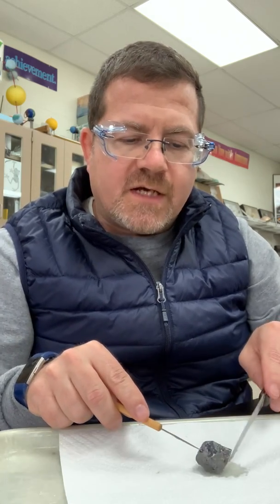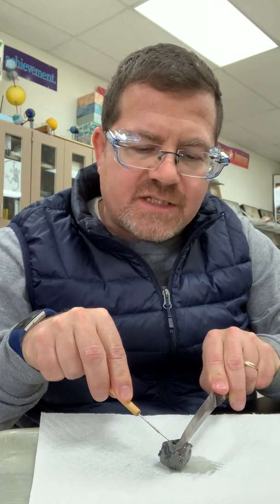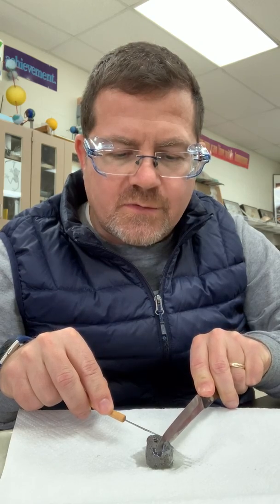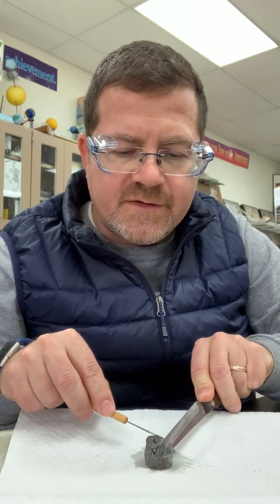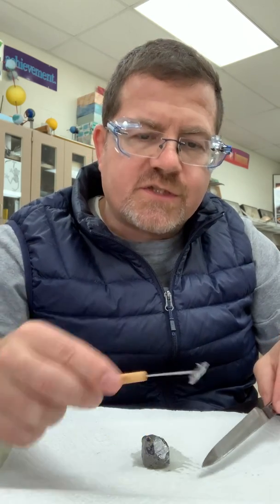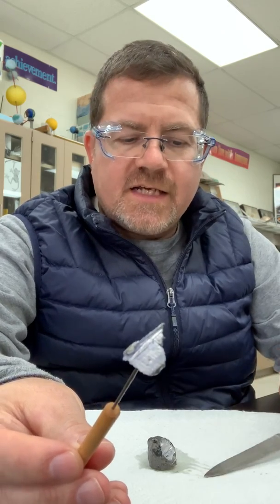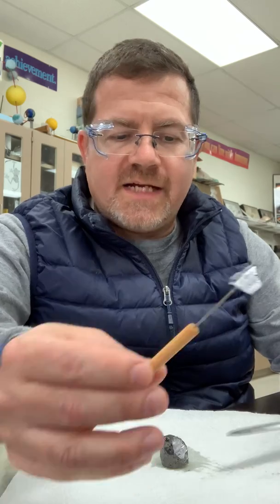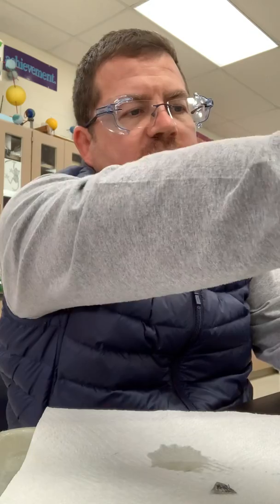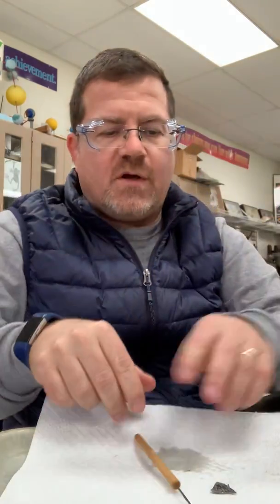And what I'm going to do is cut a small little piece of it. It's soft enough that I can actually cut it with a knife. So I'm cutting a small piece of it. And look at that. Look how high the luster is. It's very shiny, characteristic, as we know, of all metals. We learned that right before we left for break. And now I'm going to put the rest of that back in and cut up a couple of smaller pieces for this.